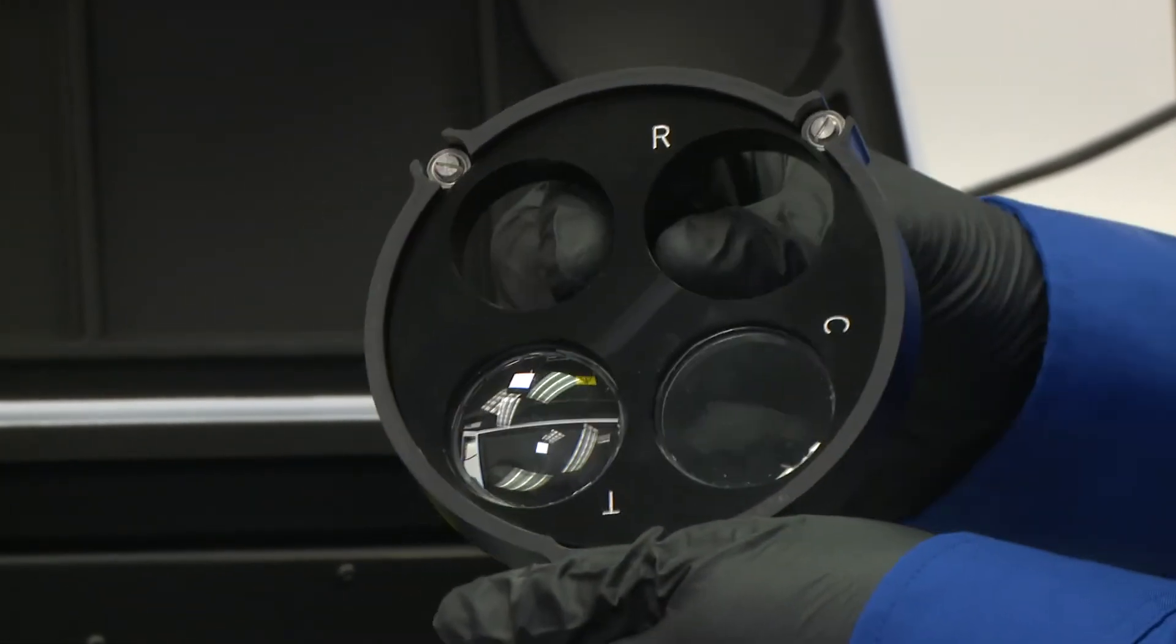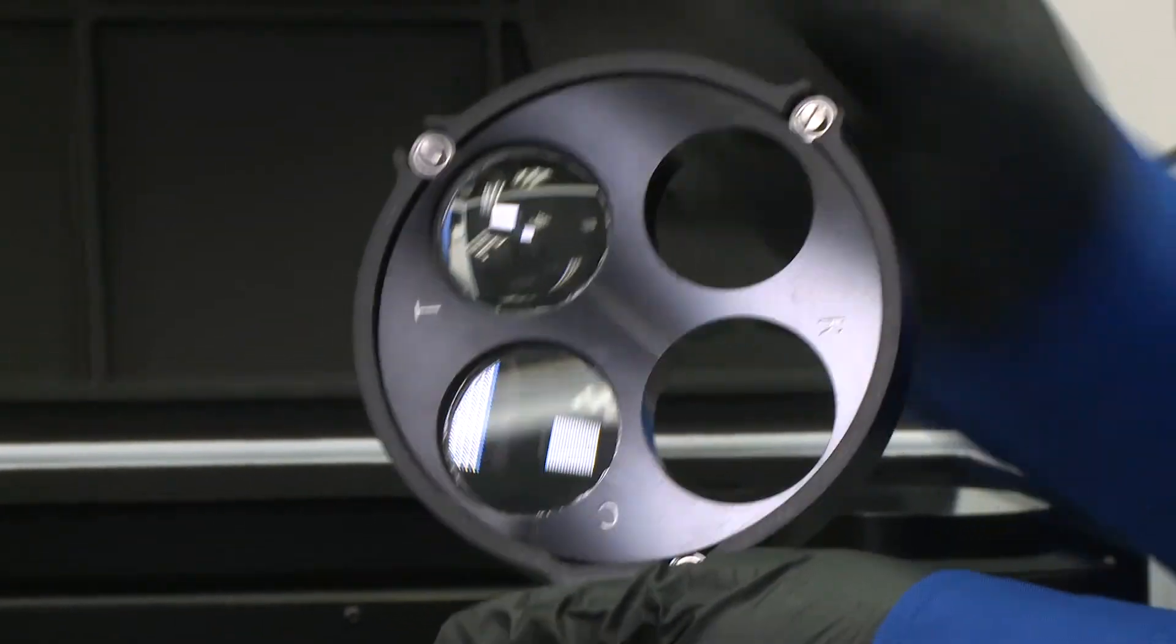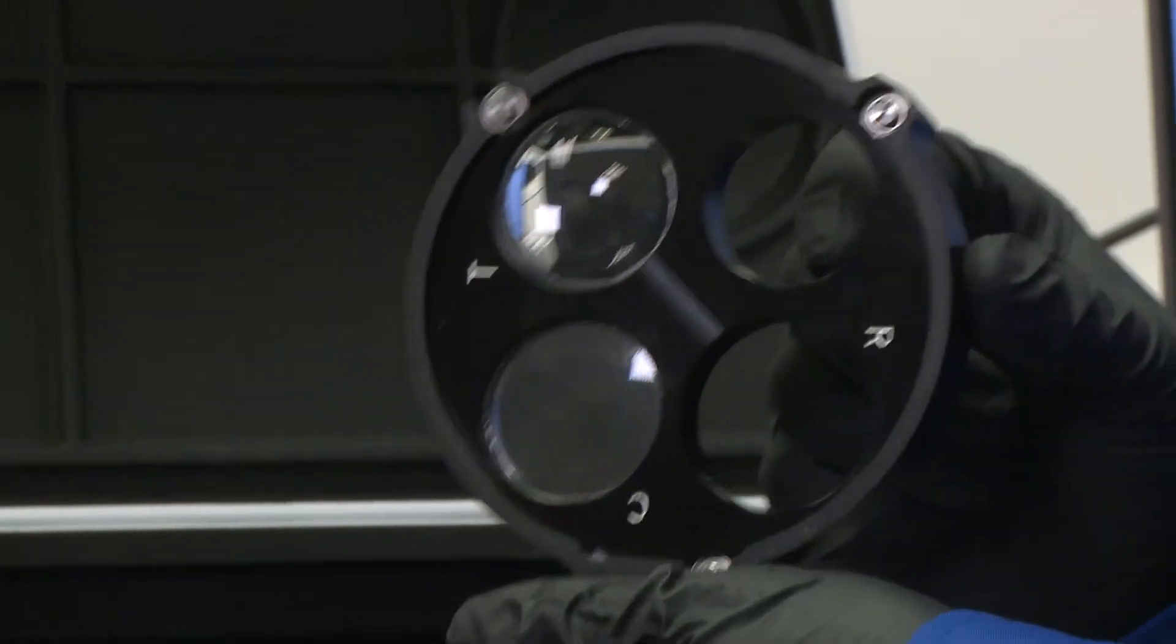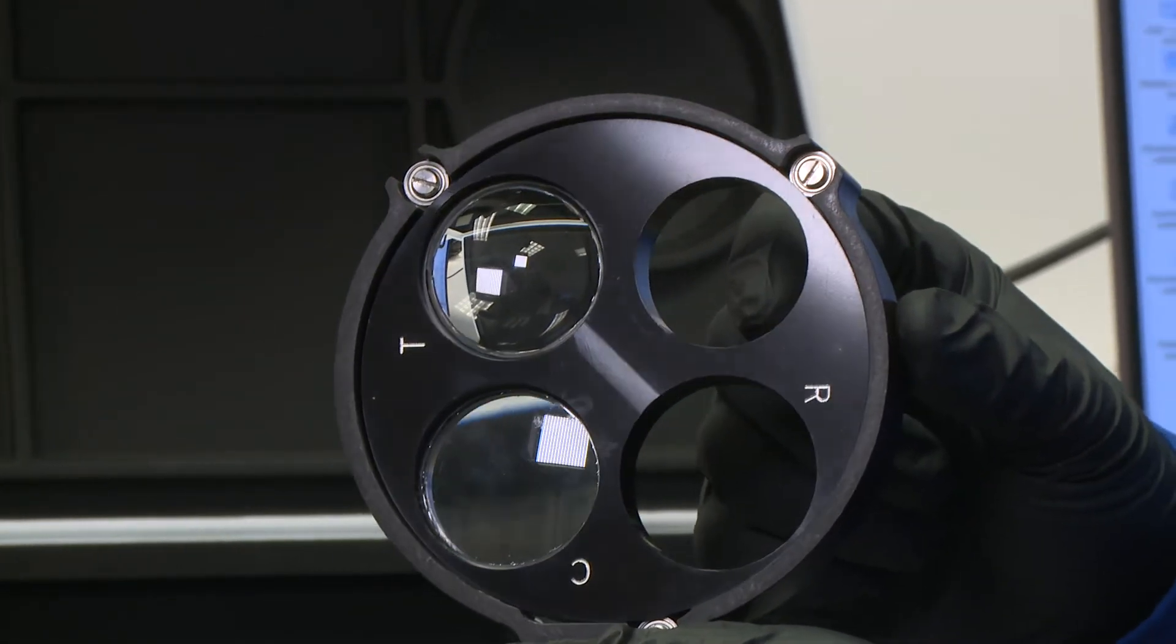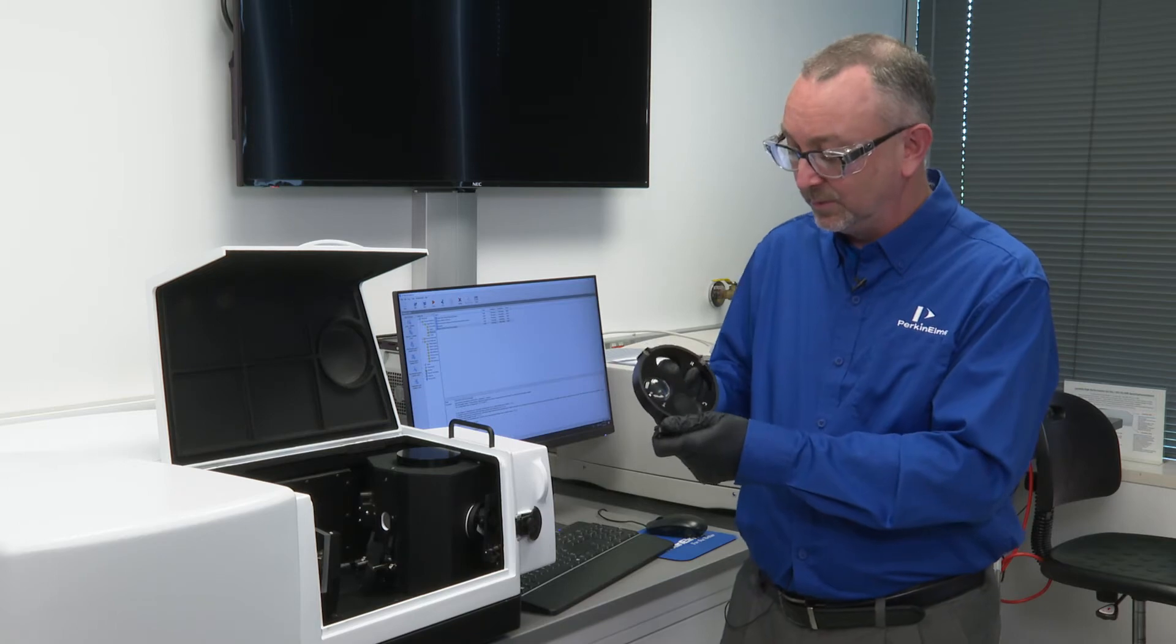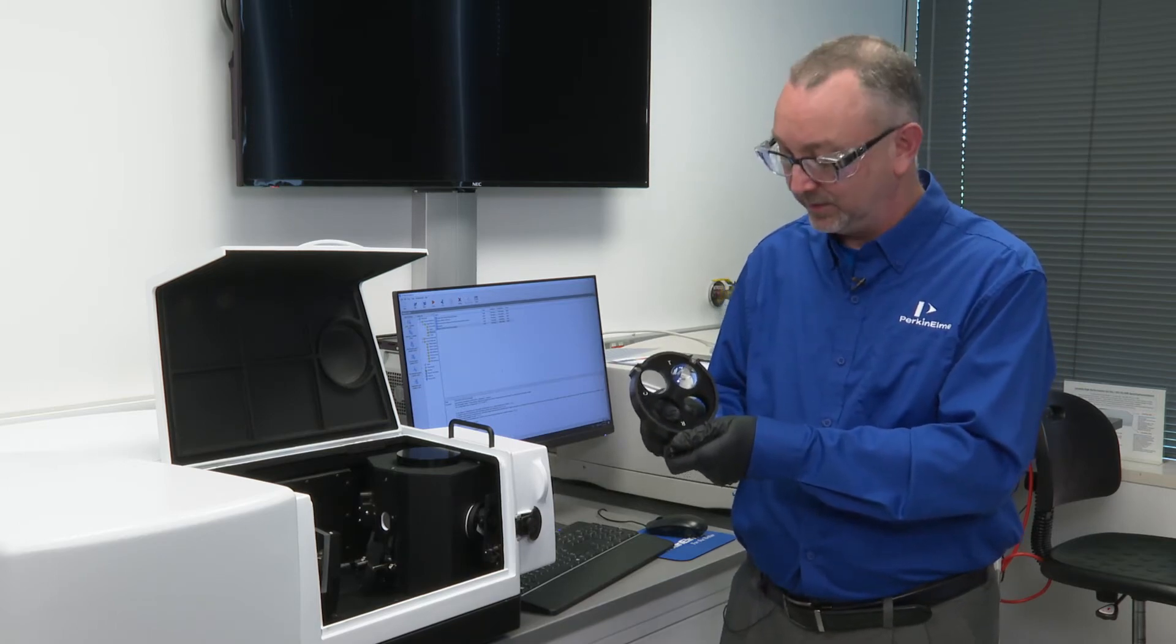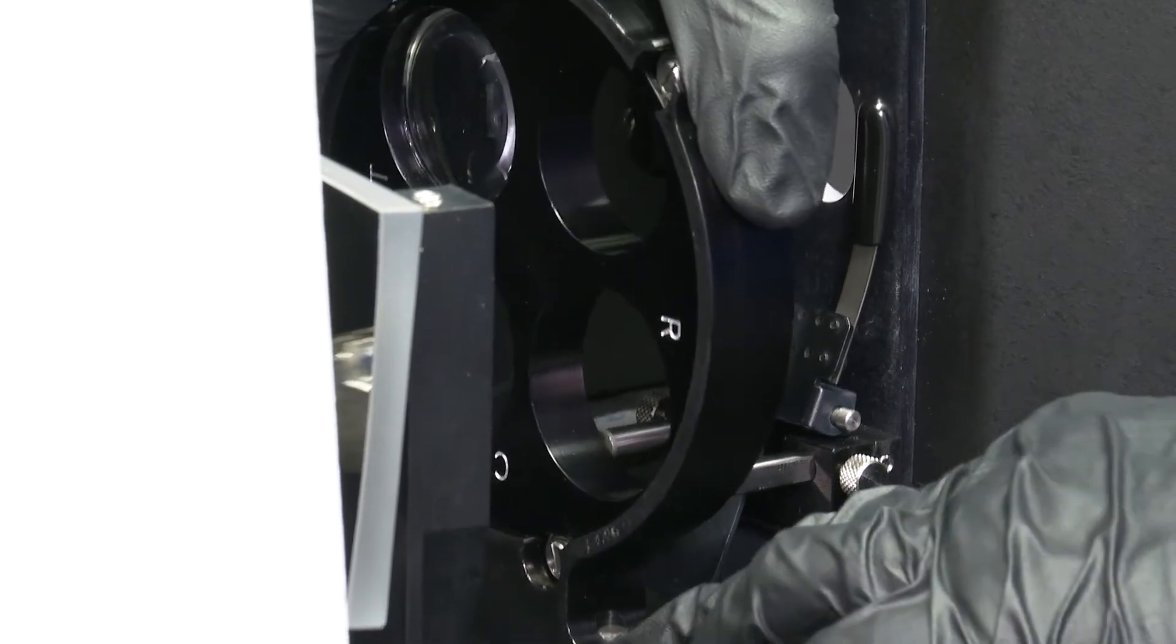There is also an open position such that the light from the instrument can simply pass through without interacting with a focusing lens. This whole thing can rotate depending upon where your sample is in relation to the sphere location.